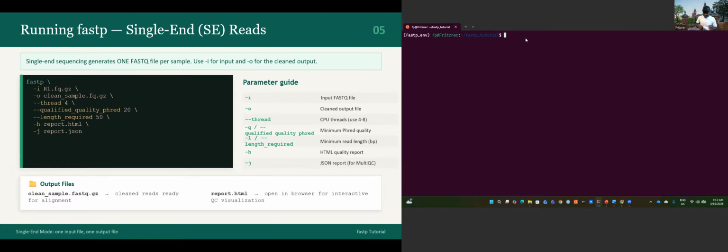But before doing that, I forgot to tell you that I recommend compressing the files. When we are working with big files, it can take time to copy or move them, but when you compress them, it's easier and you are more sure that you will not lose your file because of copying or moving. So let's use gzip. I just want to zip the first one, and let's zip the second one, R2. Let's ls. Voila, now we have .gz for all of them.